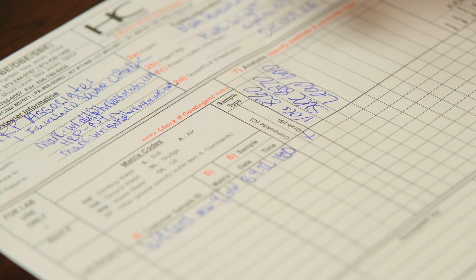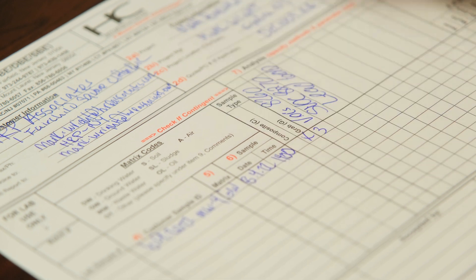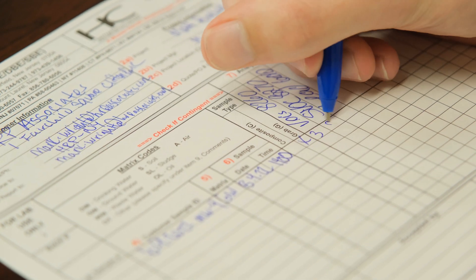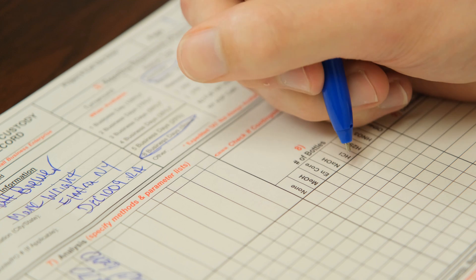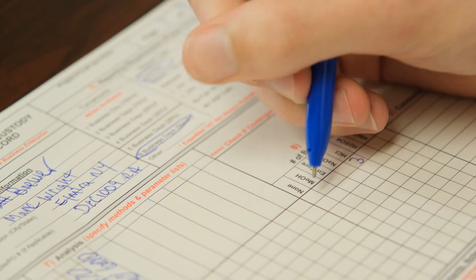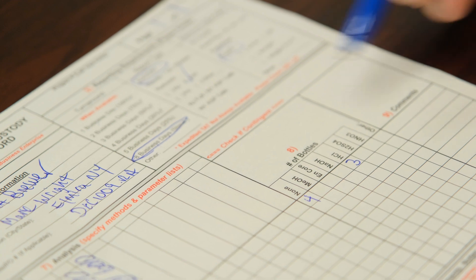Then you want to indicate how many bottles you're sending out per sample — usually it's three for VOCs, two for SVOCs if you're dealing with groundwater. And then the number of bottles that you're sending with a particular preservative is the next column over. That's more of a lab safety issue, so make sure you mark that down, again with the number of bottles that you're using.